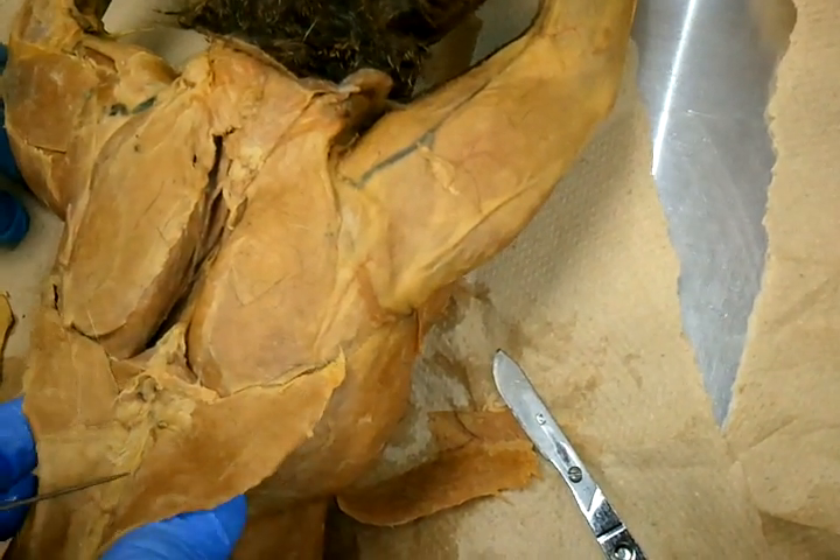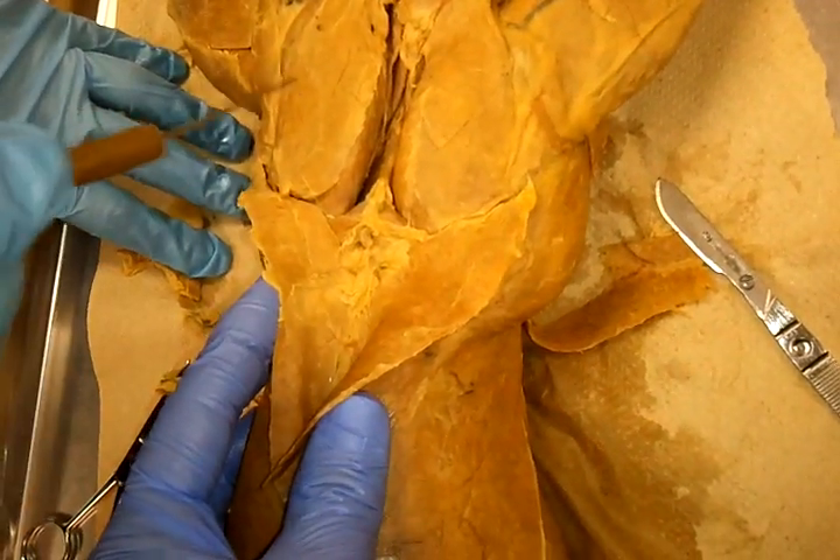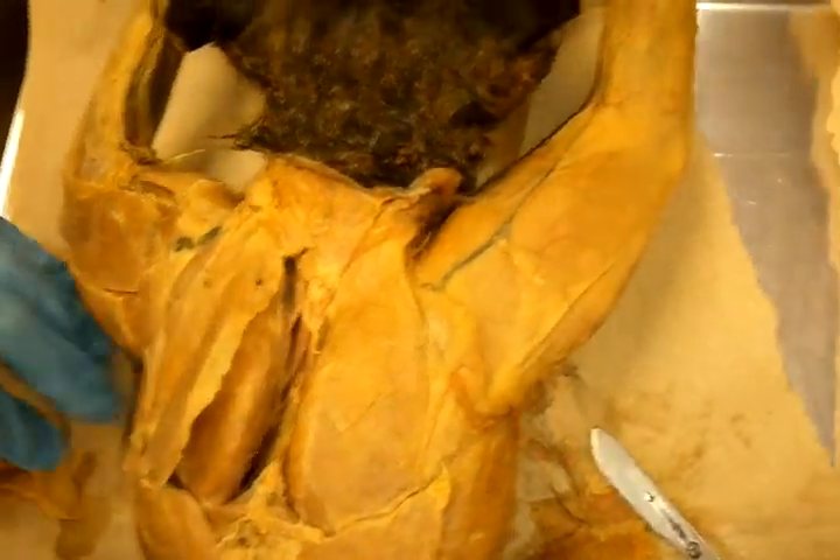See, it's attached to the spine. Spinal is the process of the vertebral column. And this one is acromial trapezius. This top one over here — muscle superficial.